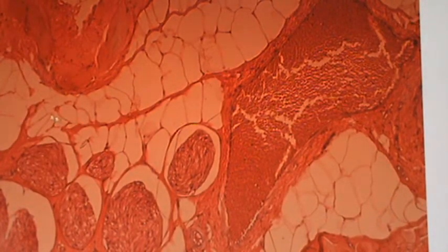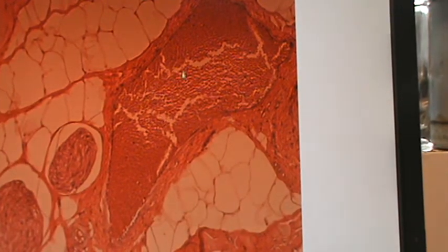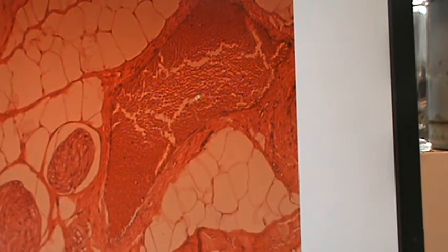Lots of adipose in this cross section. Look at that, tons and tons of adipose. And I'm pretty certain that we got some other interesting things here too. That looks like maybe some nerves, possibly. And over here you can see a big vein. Let's look across over here, and you can see another big vein over this way. And you can see all the erythrocytes inside there. So this is blood in here.